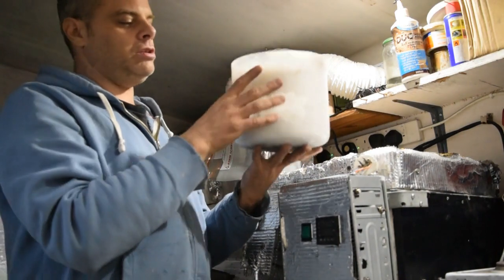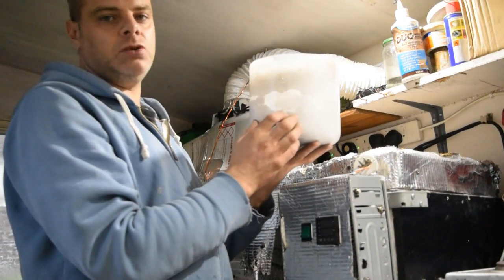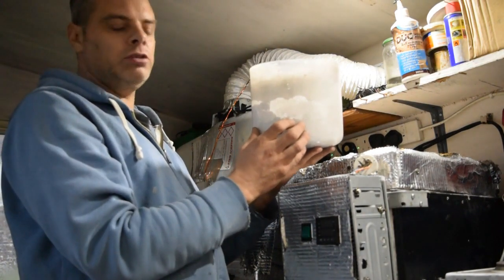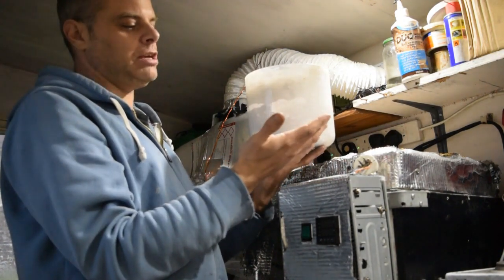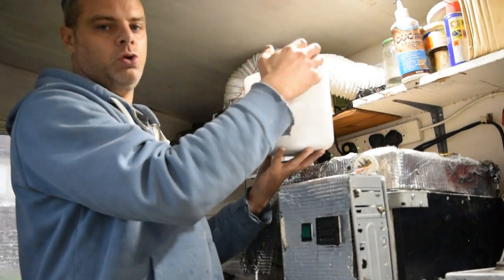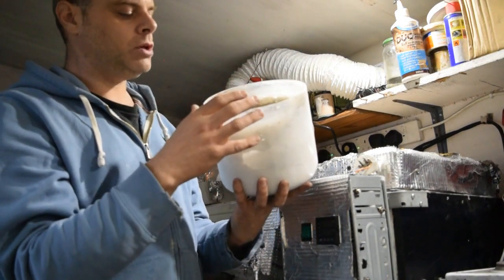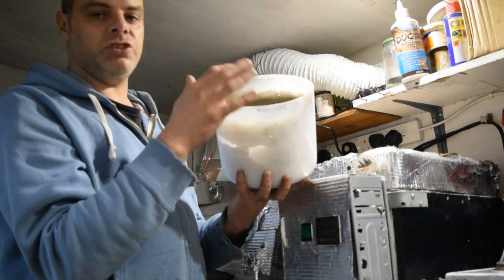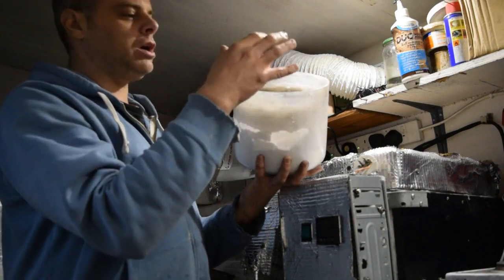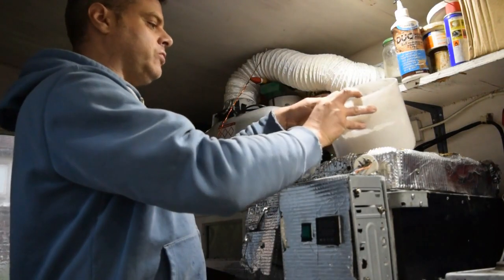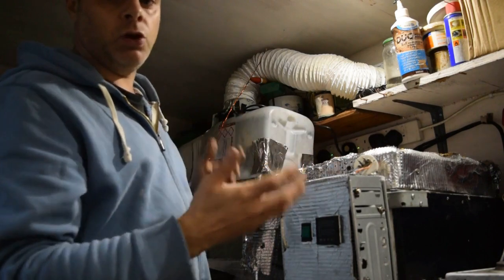Inside these, if you don't get hold of quartz glass, you can use stainless steel. They won't last as long. They're not as good. But they can be used, particularly if you go for a stainless steel with quite thick walls. Inside, we've got carbon material. We've got some charcoal briquettes, some bits of coal, and some activated carbon in there. And that all helps to create a carbon atmosphere inside, which is really helpful to graphitise your carbon and make it a lot more conductive.